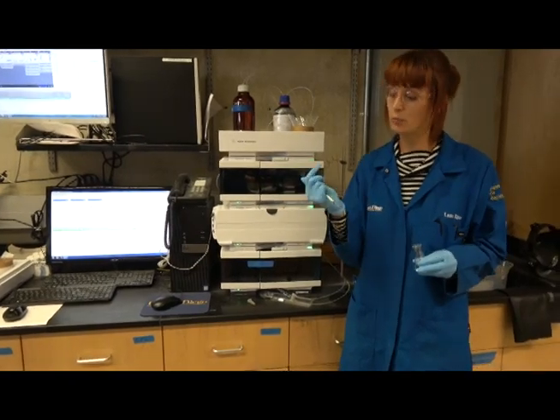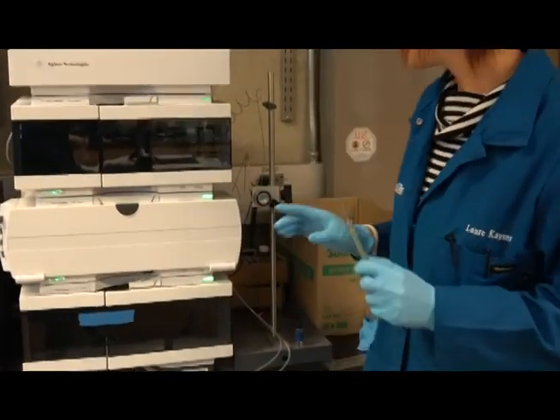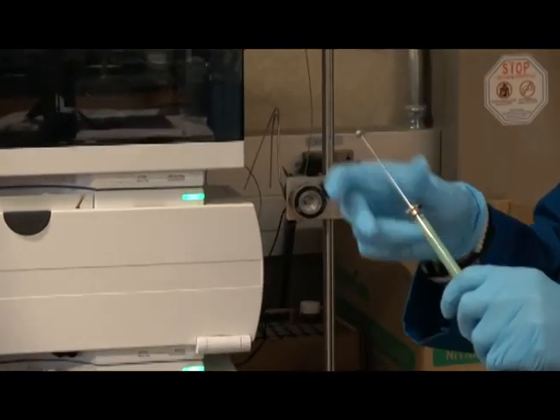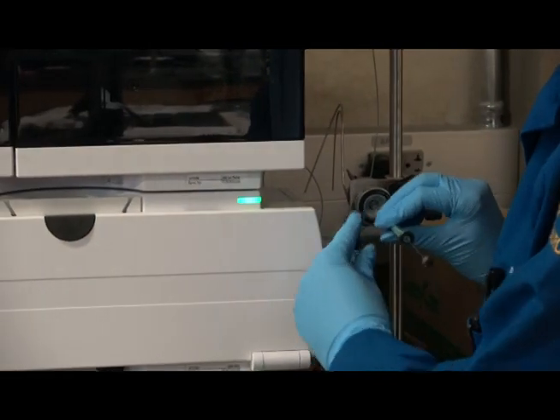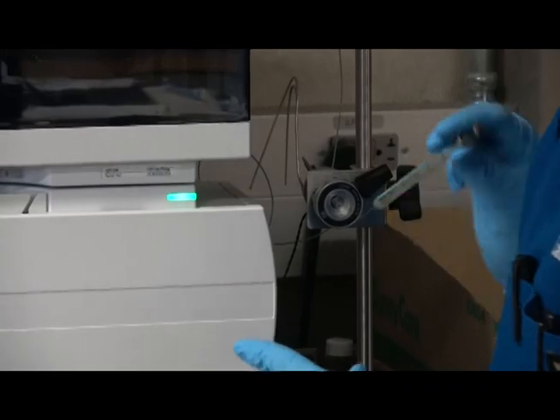Okay, so when you're done with your injection it's very important to clean your syringe and the injection loop. So what you do is you go back to load and you're going to rinse the loading station three times at least with some DI water.